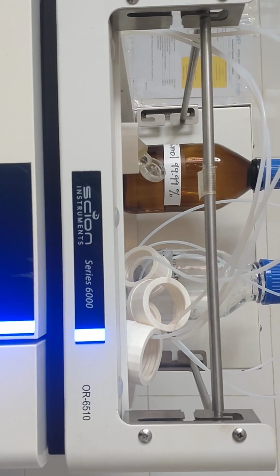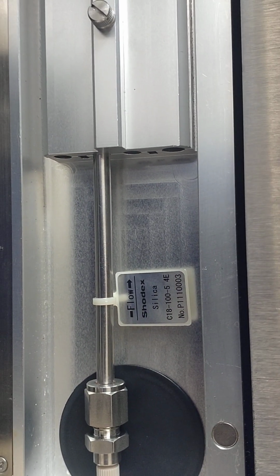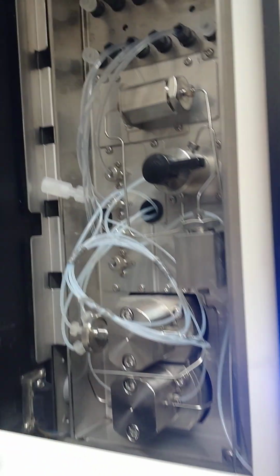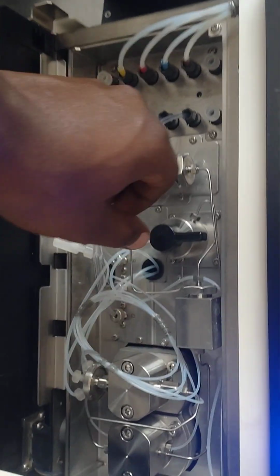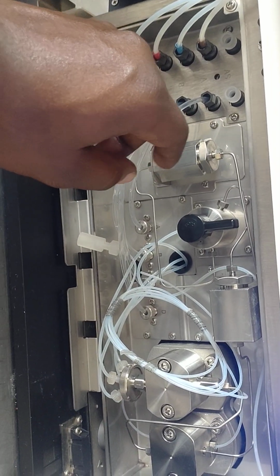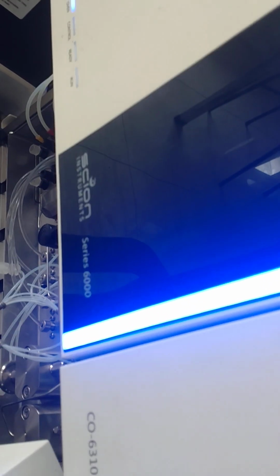And the organizer is functioning very well, and the column is not connected since the detector is not yet ready. And you can see the specification. It is C18 silica, reverse phase. And you can see the quaternary pump. It is working properly. When we are purging, we bring this button to this level, but when we want to have a continuous flow after doing purging, we have to close it. So I hope it is okay by now.